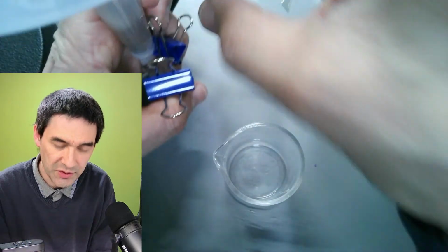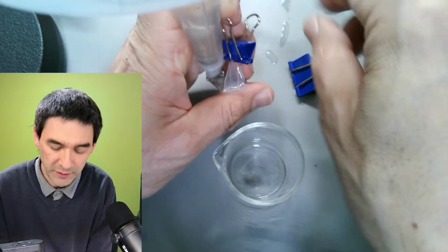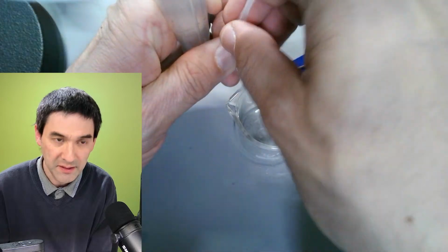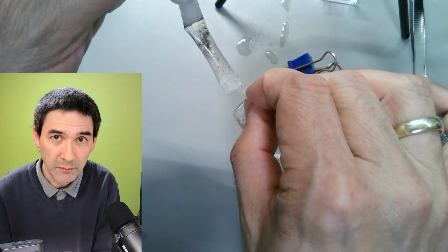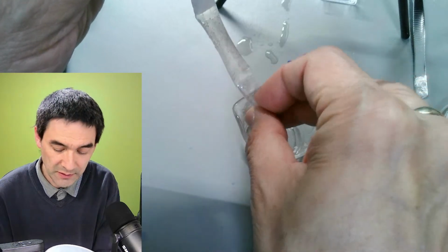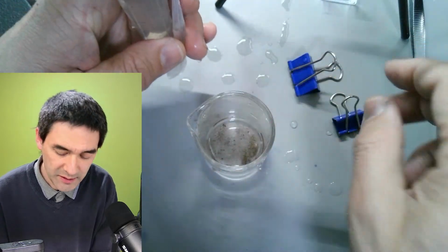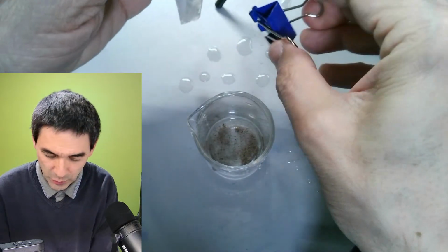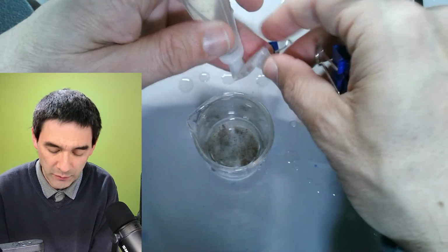Okay, because there is of course a lot of water in here. And I'm going to remove now the clamps holding it closed, and look what happens now. Okay, this is highly improvised, but you can see all of those particles in here, right? Okay, and that's it. And this stuff here hopefully contains now a lot of these interesting, hopefully interesting organisms. So I'm clamping this one off again.